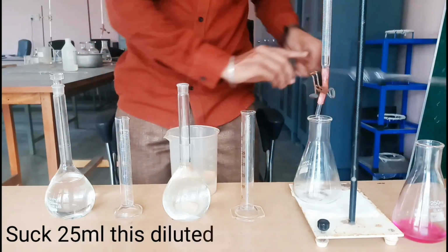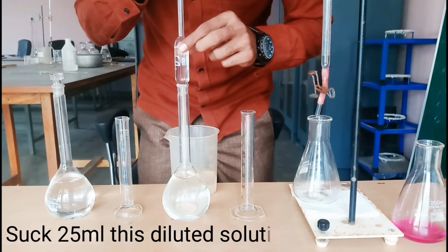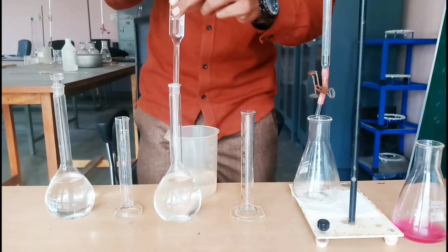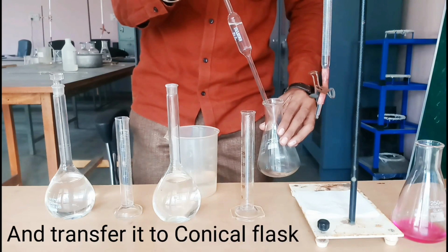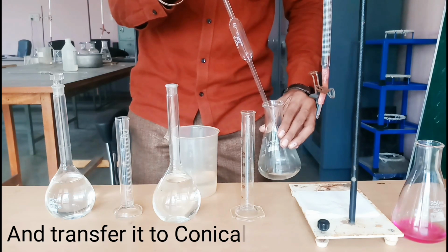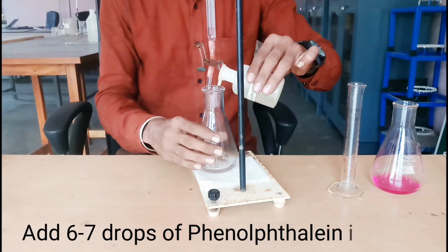Suck 25 ml of this diluted solution. And transfer it to conical flask. Add a few drops of phenolphthalein indicator.